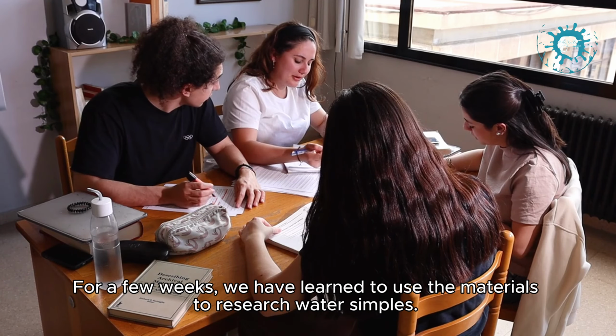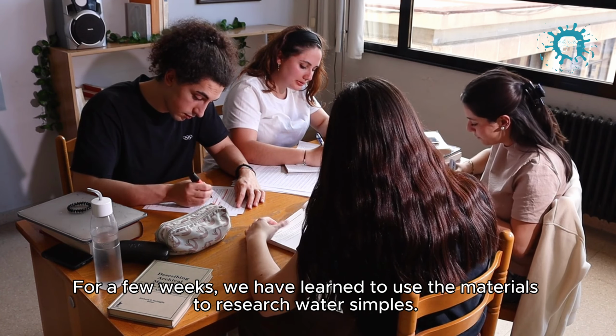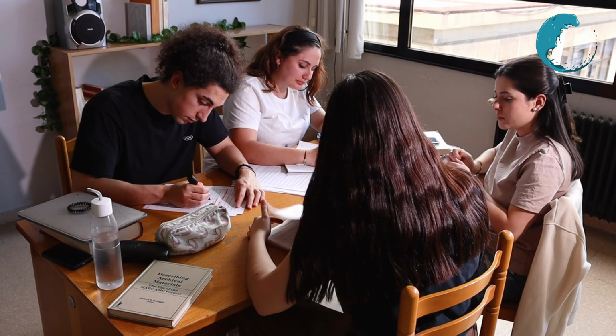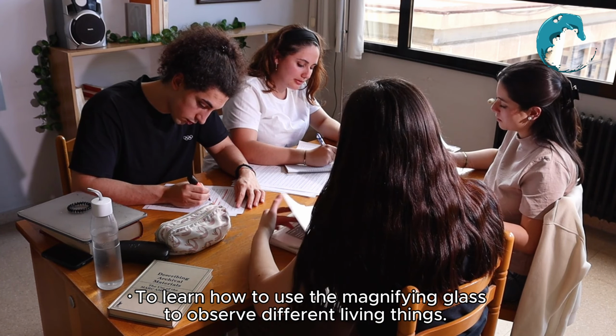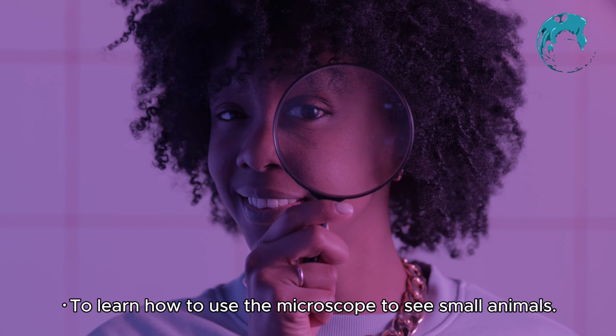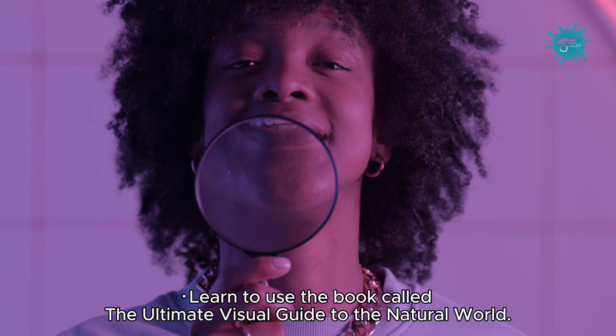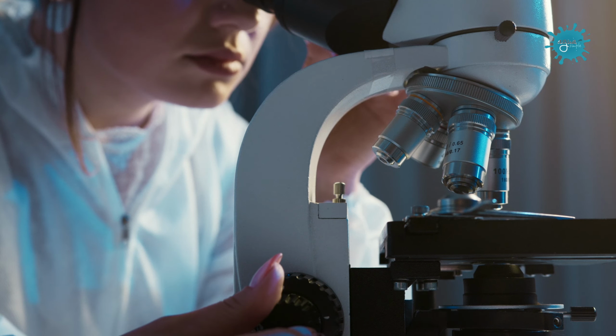For a few weeks, we have learned to use the materials to research water samples. Objectives: to learn how to use the magnifying glass to observe different living things. To learn how to use a microscope to see small animals. Learn to use the book called The Ultimate Visual Guide to the Natural World.